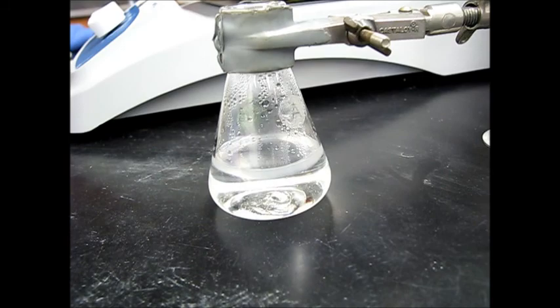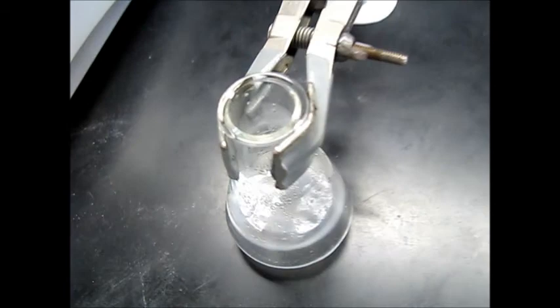So we're going to let this cool down a little bit more. As it cools, we should be able to see some more crystals forming. Once it gets down to about room temperature, we're going to go ahead and put it in the ice bath for a full recrystallization.